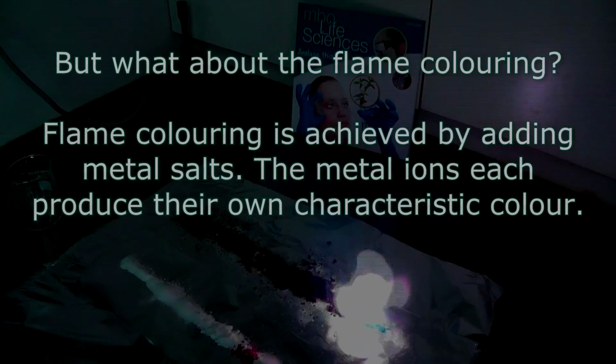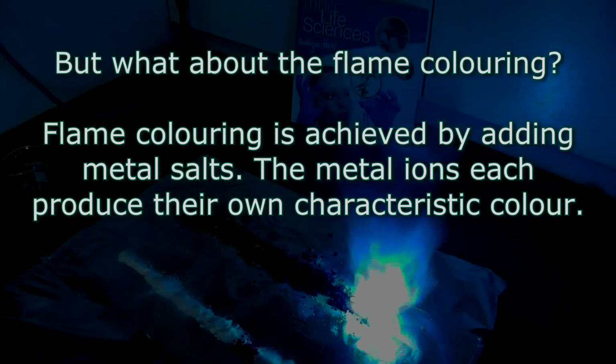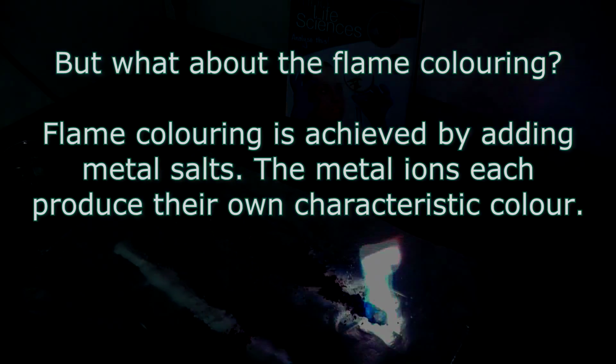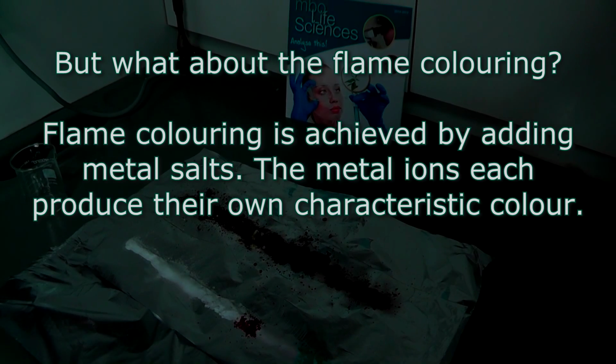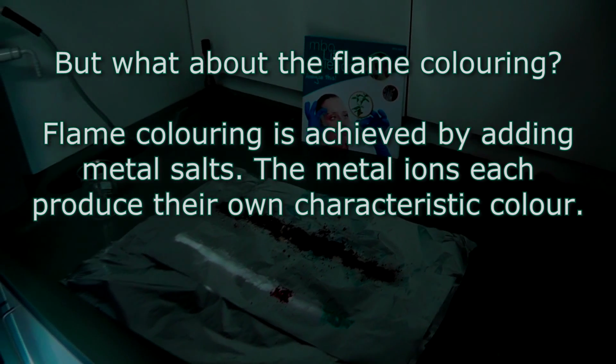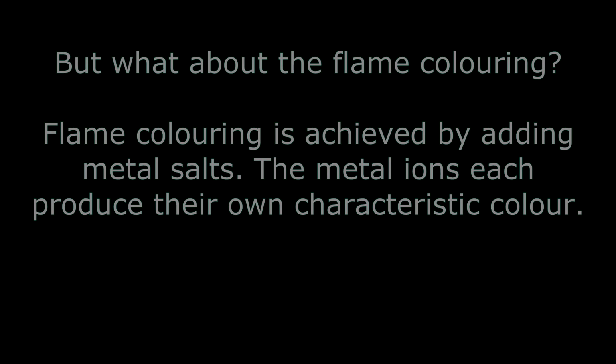Now that we've covered the redox reaction, let's take a look at the flame coloring. What produces the flame coloring in this experiment? The flame coloring is produced by different metal salts. For this experiment we chose a variety of salts containing metal ions and alternated them along the line of sugar and oxidizer. Each metal ion produces its own characteristic flame. Let's take a quick look at the salts we've used and the flame coloring each produces.